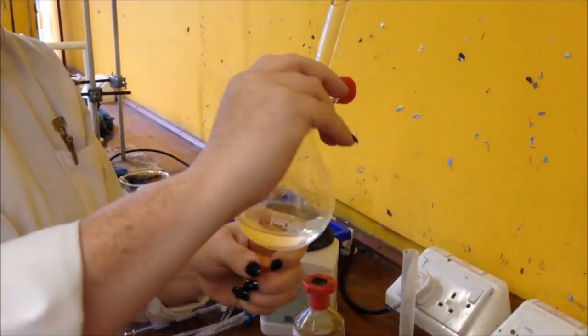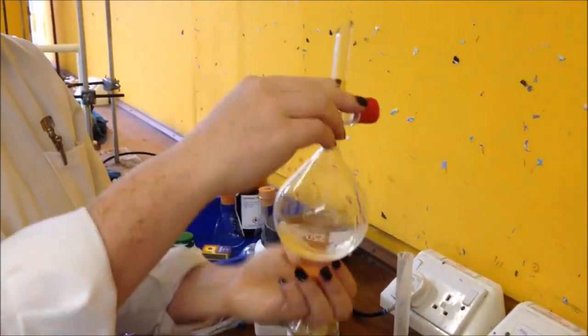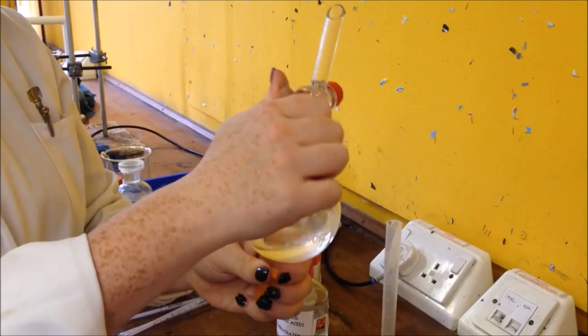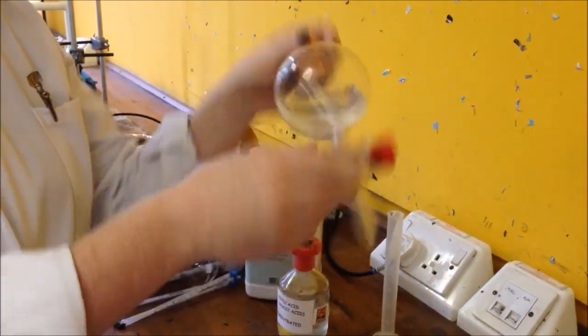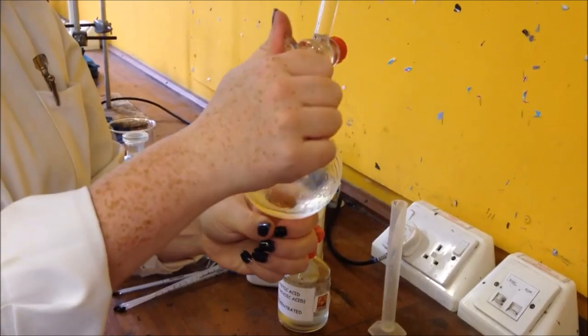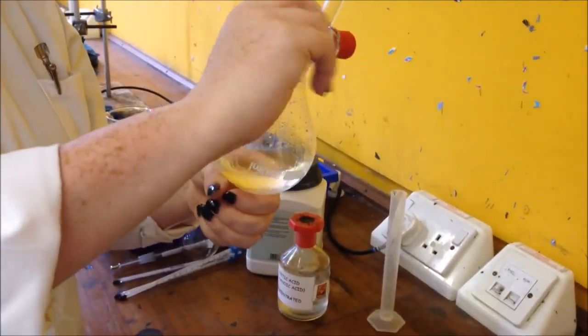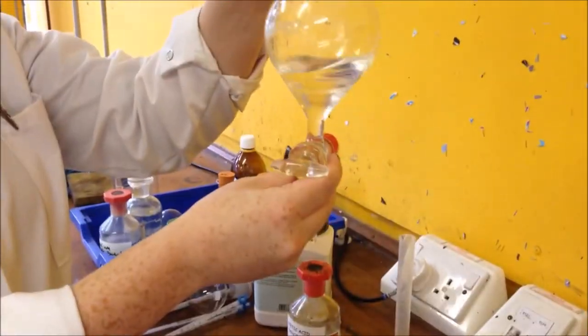Open the tap to release the gas. Mix it a couple more times. Open the tap to release any gas. And then keep mixing it until you can't get any more gas released. And let it separate out.